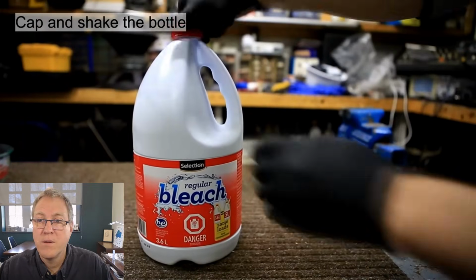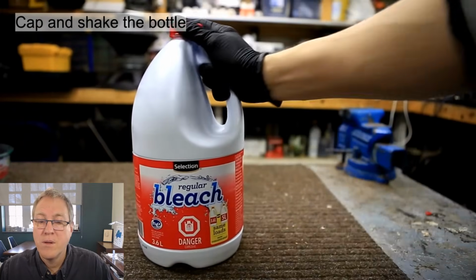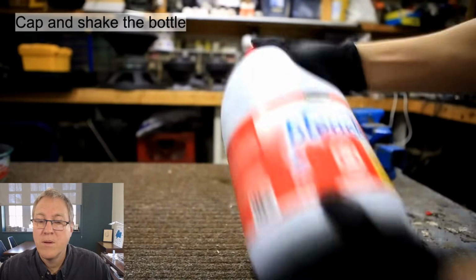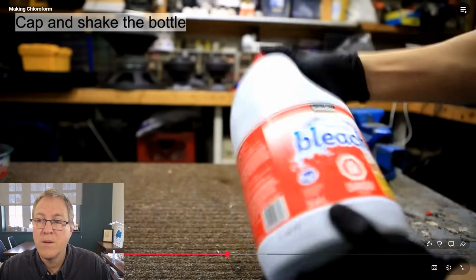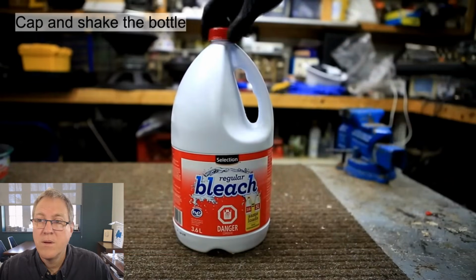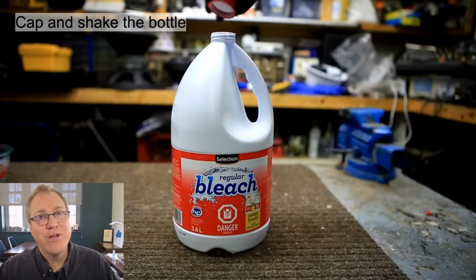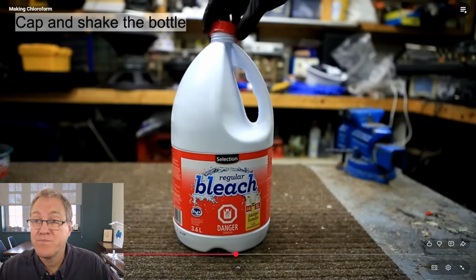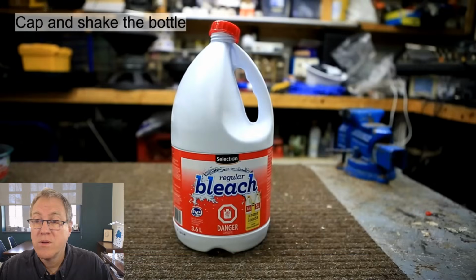After adding the acetone, the bottle is capped and shaken. The cap is then removed and placed lightly on top to allow any gases to escape. I left the bottle overnight to allow for a complete separation of the chloroform from the aqueous layer. Now, if I were going to shake that up, I'd probably invert the bottle some. I would have probably shaken it up a little bit more, but I'll mention why that might be a bad idea in just a moment. Chloroform is denser than water and immiscible, so it should form a layer on the bottom.